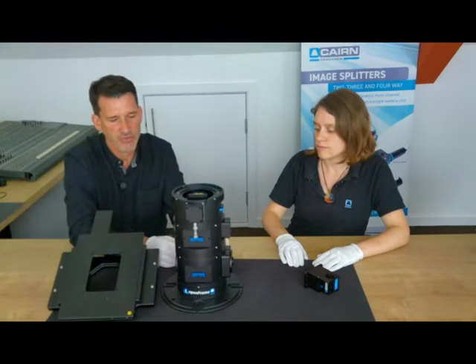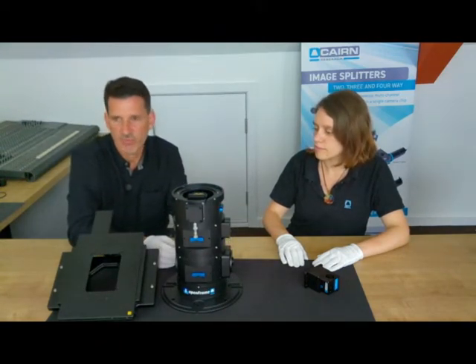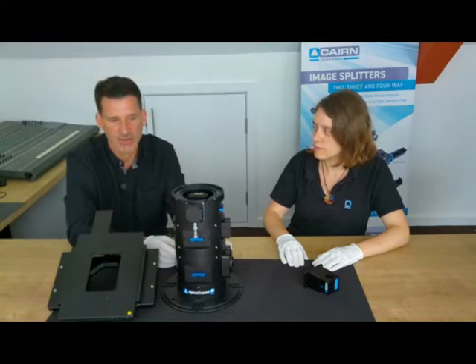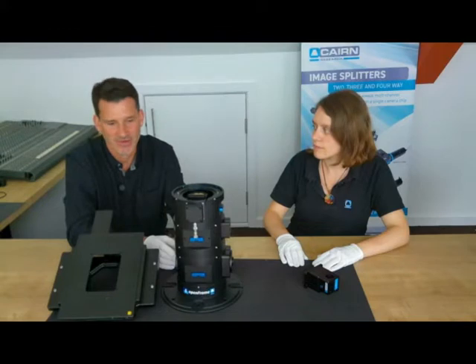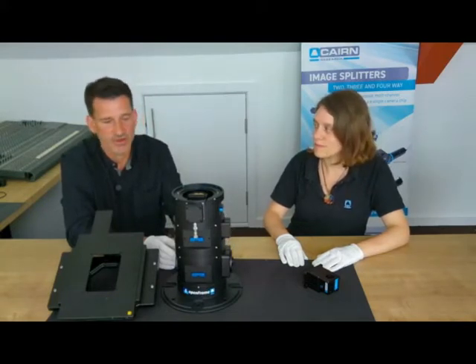For those with more of a budget or more requirement for 2 cameras simultaneously, for example, if they're using a colour camera in lieu of the eyepieces that are manifestly missing from this microscope, quite deliberately, then we have a 2-position slider, so we can go from left to right automatically.